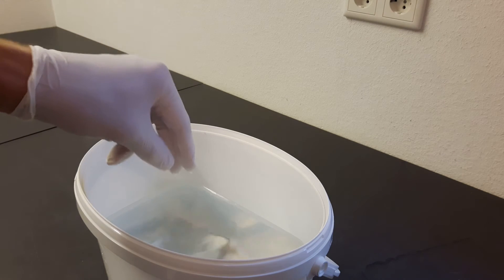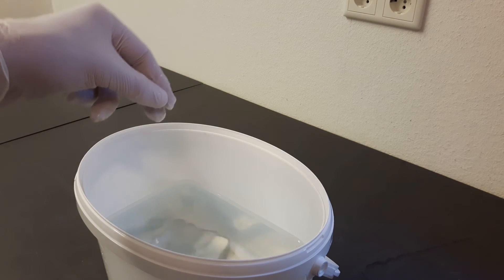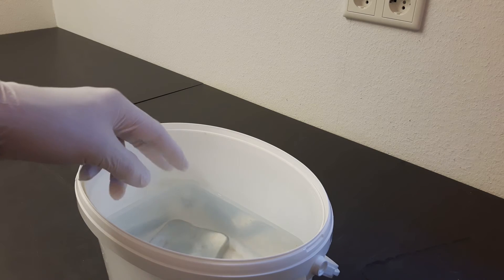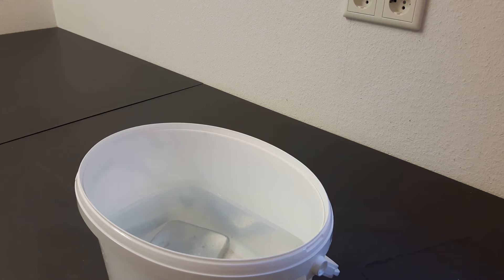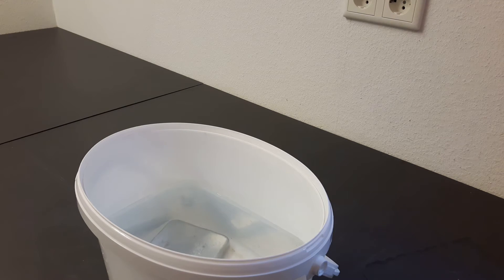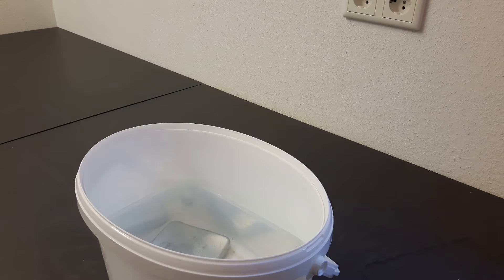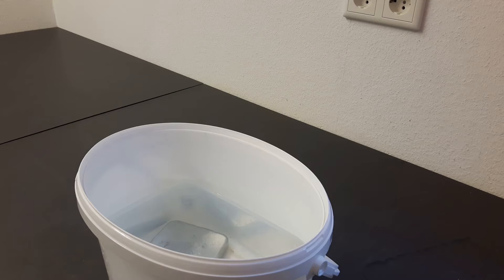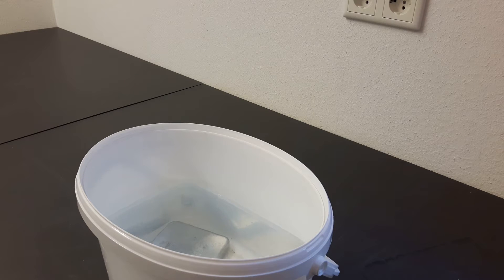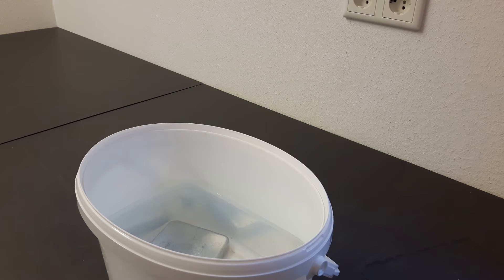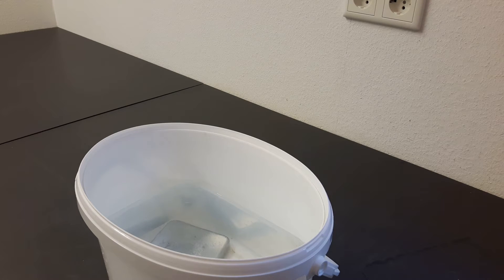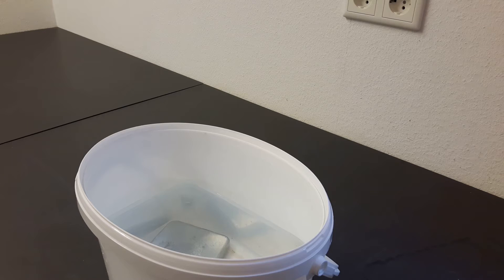Unfortunately, I did spill some water over the top, about 10 milliliters, because I was a bit careless.